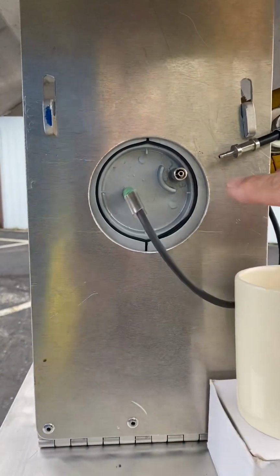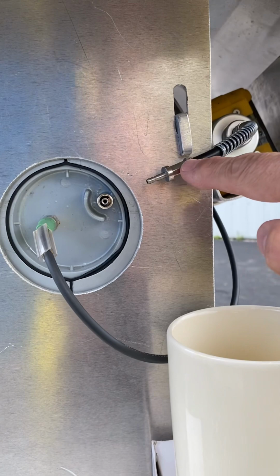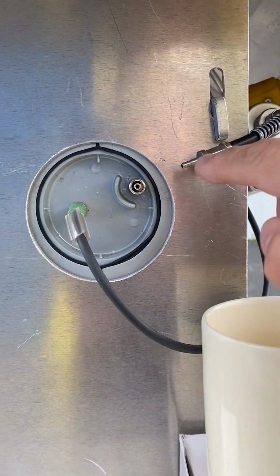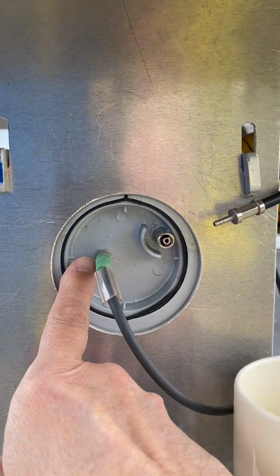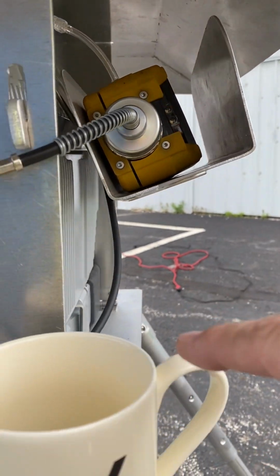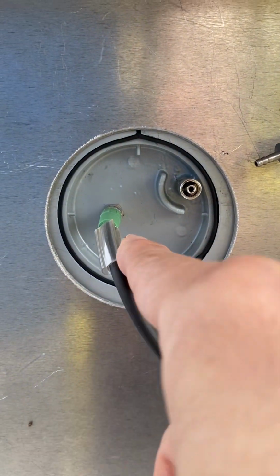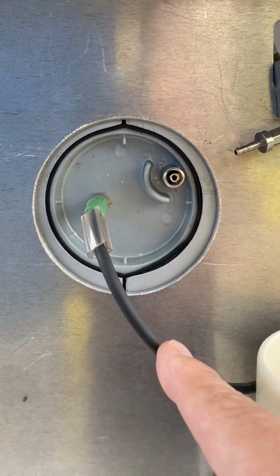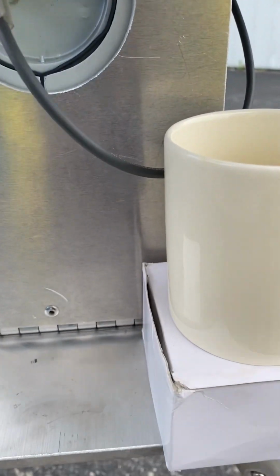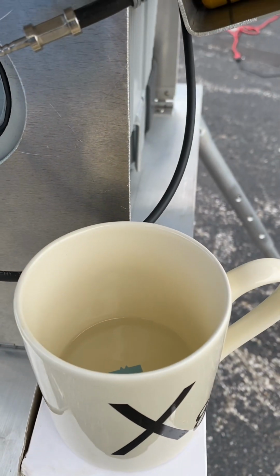Over here, on the front side, we have an instrument. This is an inlet of our gas detector. And we have another instrument here taking a sample. And then we also have the communication from that MiniRAE. It's a MiniRAE 3000 over here. And that cable is connected to that unit, and it's that way. And so we are going to make that connection here. Makes it simple. And here's my source. You were wondering where I get that acetone from. I'm using it in the acetone connection right here.